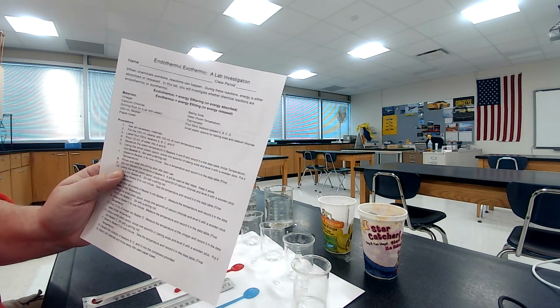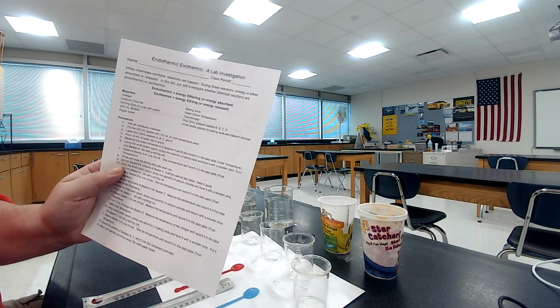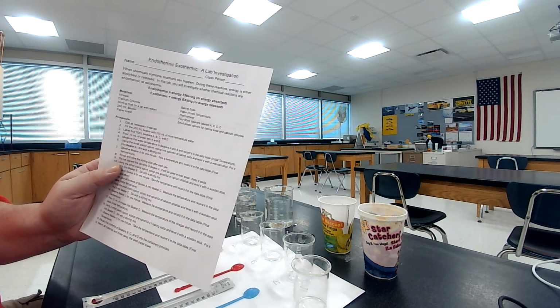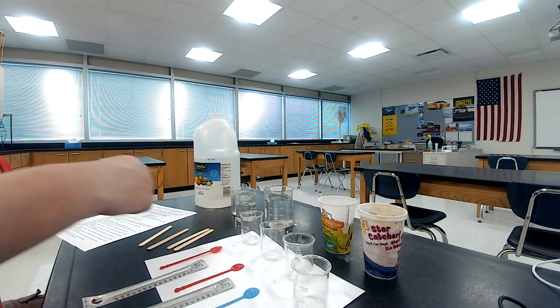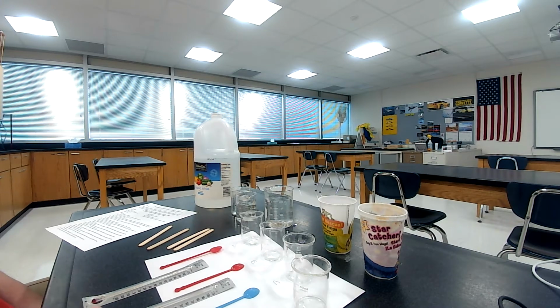I'm going to today be doing the lab investigation with you called Exothermic or Endothermic, a lab investigation. This video is going to take you through how to do it. You're going to need to observe it so that you can get the data that you need to complete the lab. It's actually a pretty easy activity. It's just a matter of really following directions.